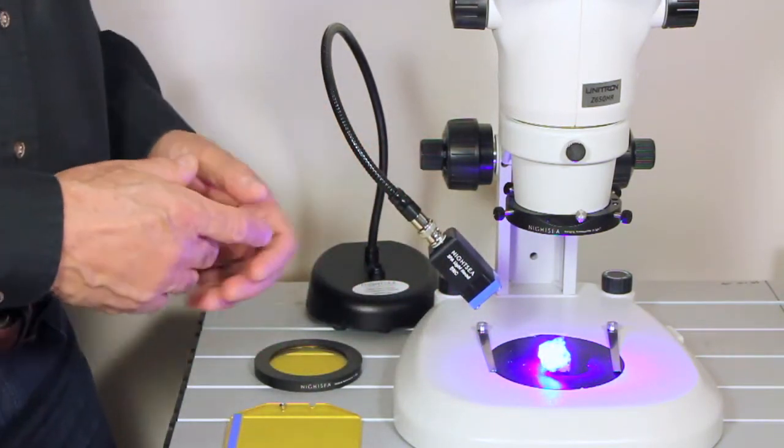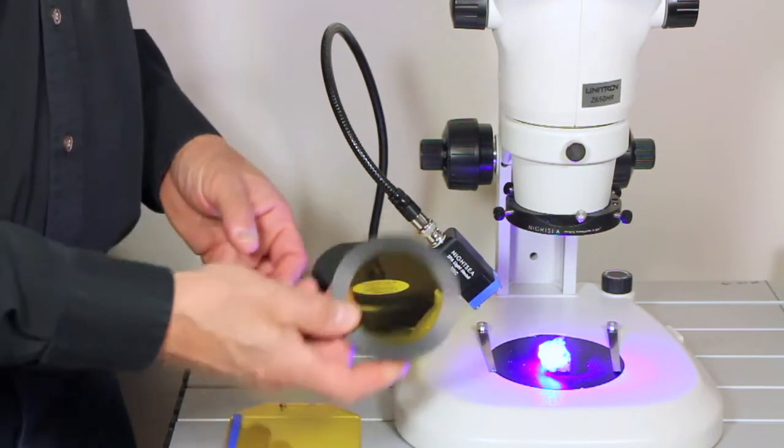Now it looks like we're shining bright blue light on the rock, which is not that interesting. So we need a barrier filter.